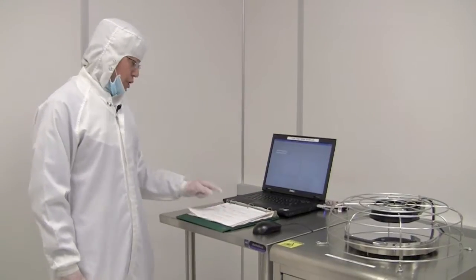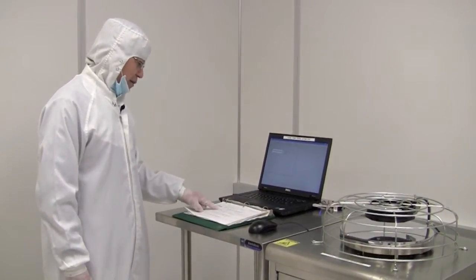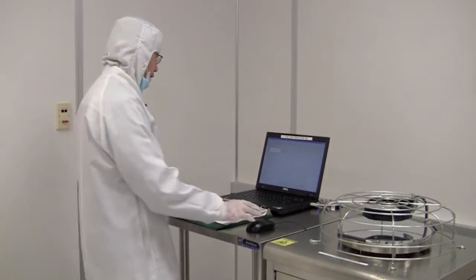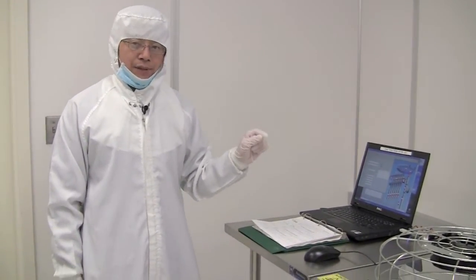Before you log in, you need to take a look at the log sheets. If everything is fine from the last user, you then log in. Once you log in to the computer, you need to go to the chase room to check the nitrogen pressure and the pump status.